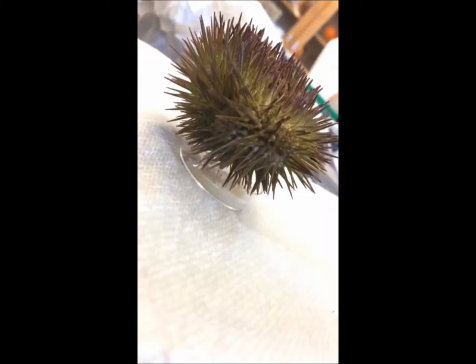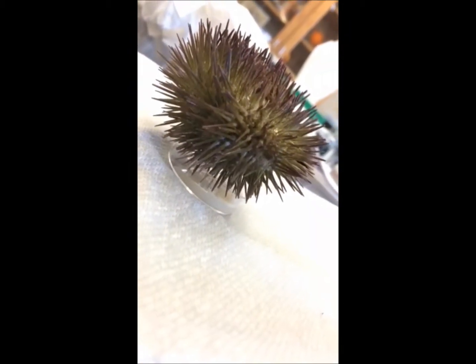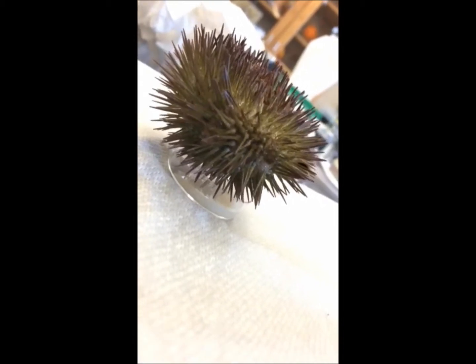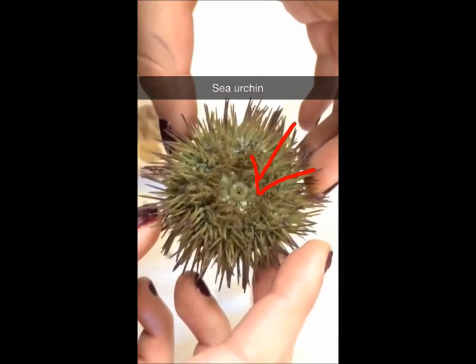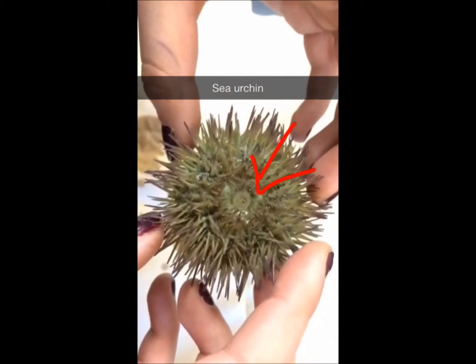Come on, open. Just watch all that sperm come out of the sea urchin. Well it's wet. It's a lot of sperm, but it's just thick. Look at it move! It's moving! It's moving — do you see it?